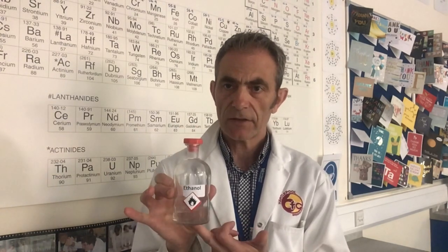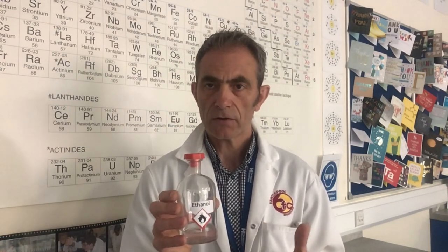The first thing we need to do is establish which solvent we're going to use. For this practical I'm going to use ethanol because aspirin is soluble when ethanol is hot, but it's not as soluble when the ethanol is cold. We need a solvent that your solid is soluble in when hot but not very soluble when cold. So for aspirin, ethanol is the solvent we're going to use.